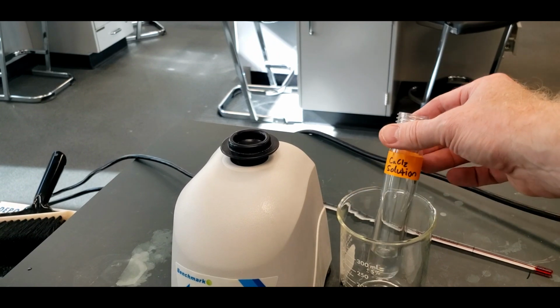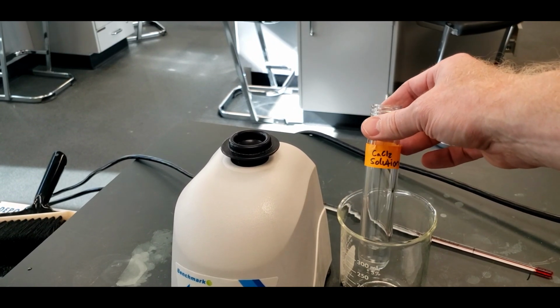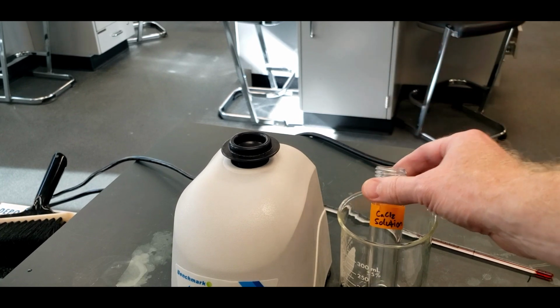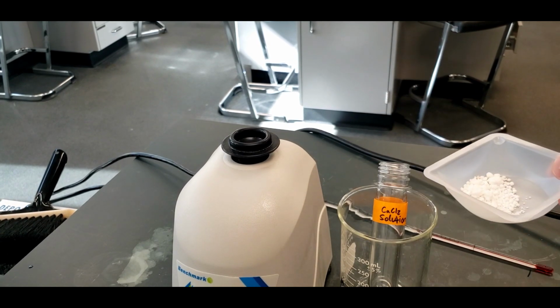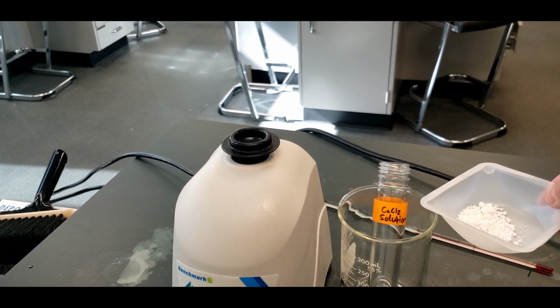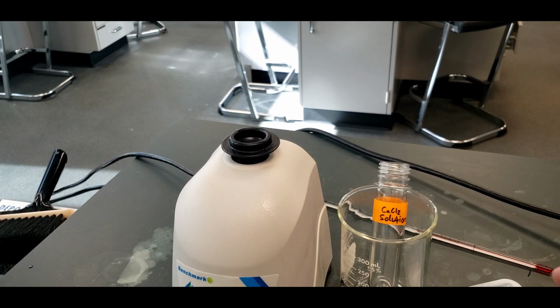Now we're going to measure the temperature change of the calcium chloride solution. Right now this is 6 mils of distilled water, and I have 4.416 grams of calcium chloride in here. In the lab it says to weigh out 4.4xx. And what that means, when you see those x's, is that you need to have 4.4 grams, and then whatever those two x's are doesn't matter. It can be anywhere from 00 to 99, that's fine.